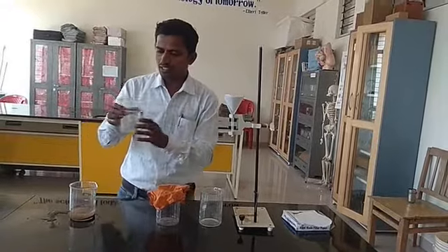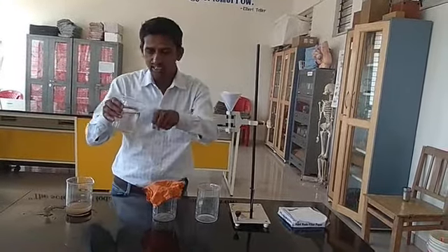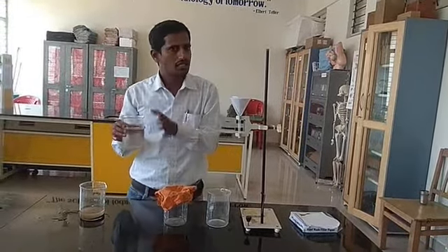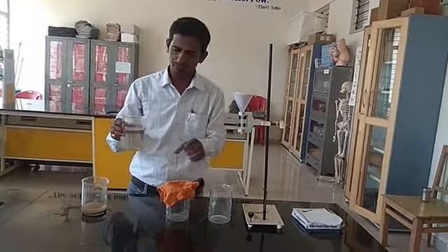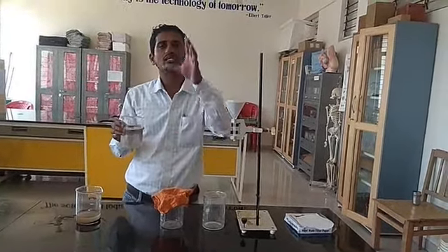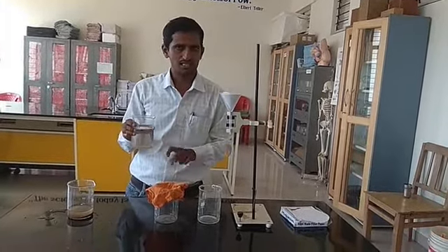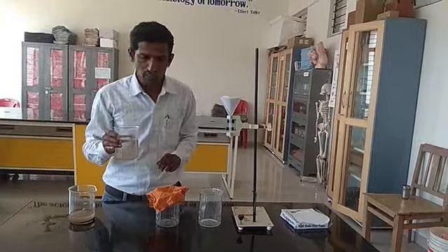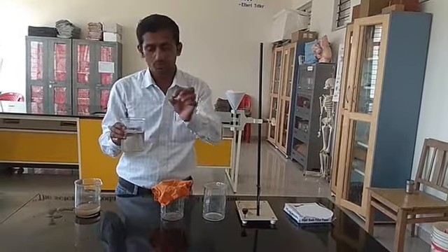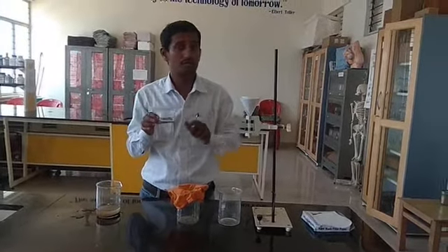If I transfer this water into another beaker using a strainer, we get some amount of purer water. That is the second method. But even after filtering through a strainer, the water is still a little muddy or brown in color — you can see it is still somewhat muddy.